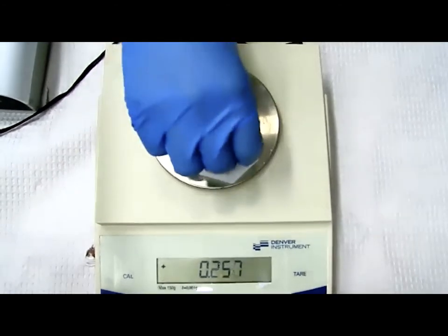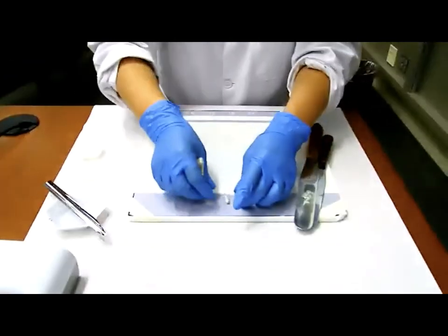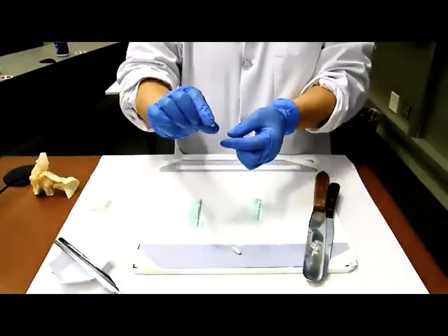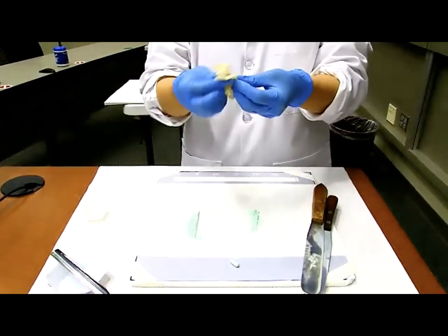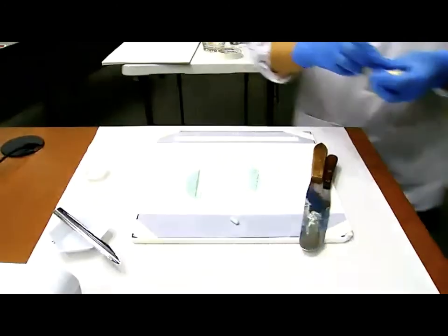All right, don't forget the pinch and the polish. But before we do that, I want to place those 2 capsules over here. Hopefully you can tell the difference, using your imagination: this one is the pinched one that's shorter and this one's the longer one that's non-pinched. So here is the pinch. You pinch to the point that you feel the click. That means it's locked. Now go ahead and polish your capsule. For me, this is my last capsule. You polish it. It's shiny now. And go ahead and double check the weight.